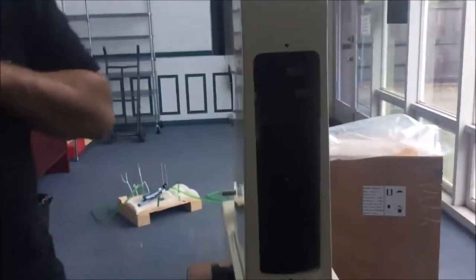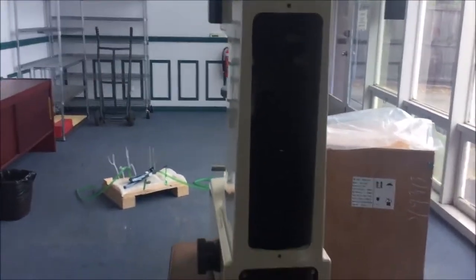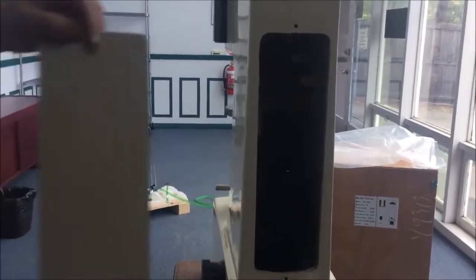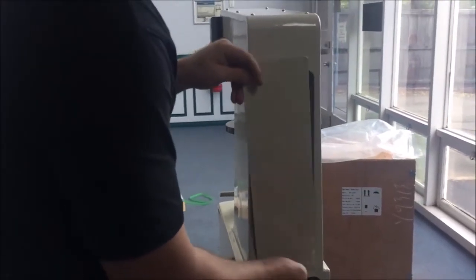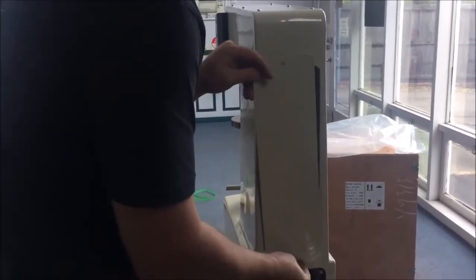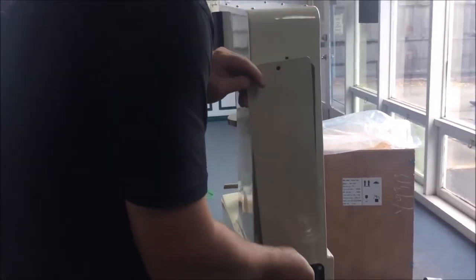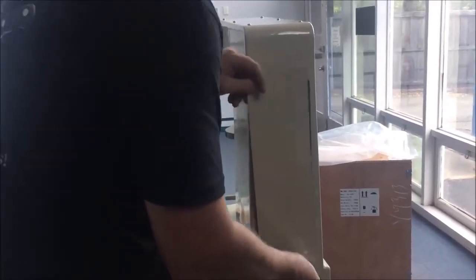You get the picture, or probably you don't. It's pretty straightforward, basically just hang them on a hook.